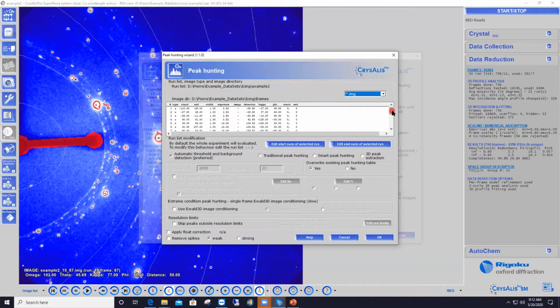And this is only to show you that the first data that I gathered here were from scan number 9, which, if I remember what I showed you in the reciprocal space before, is one of the first scans that is really dirty. Okay, so the first 8 scans were discarded from peak hunting. So basically, the cleanest data, I didn't use it. I'm just using the dirtiest part of the data set here.